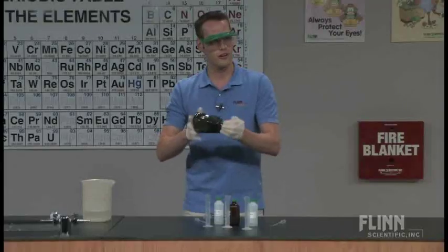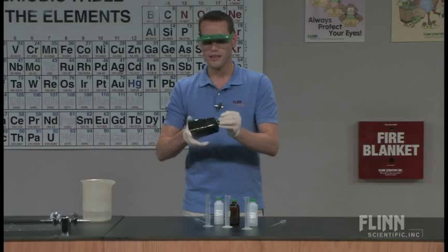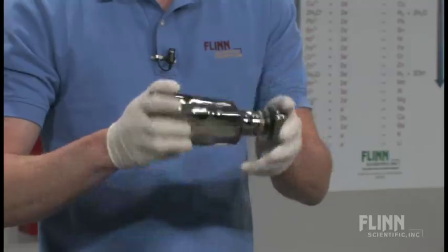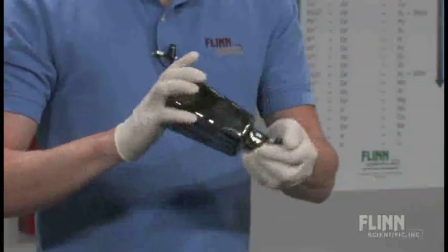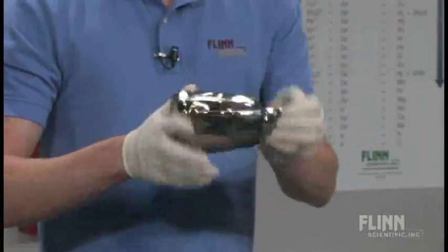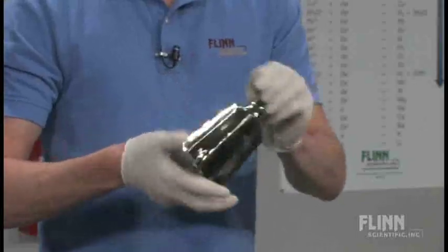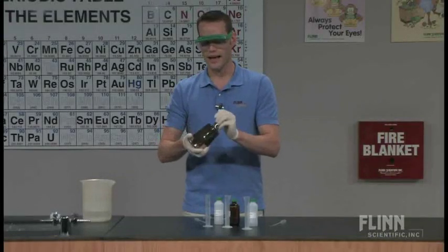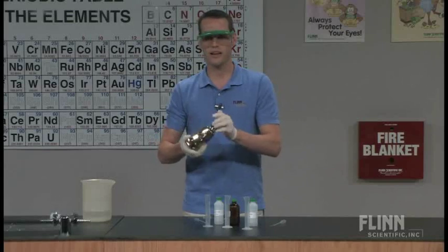They get more and more impatient the longer they keep stirring this stuff around, because they want that mirror to start forming. And the thing that's really fascinating is that you need a lot of a particular atom before it starts demonstrating the properties of the bigger material. So you have to build up quite a bit of silver atoms on the surface of the glass before you start to see its reflective quality.